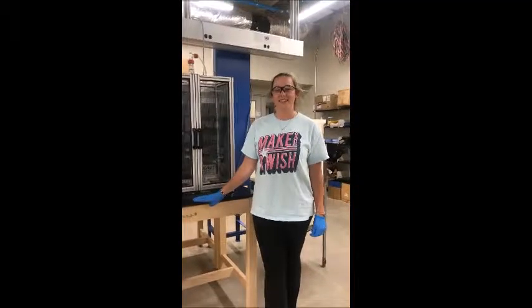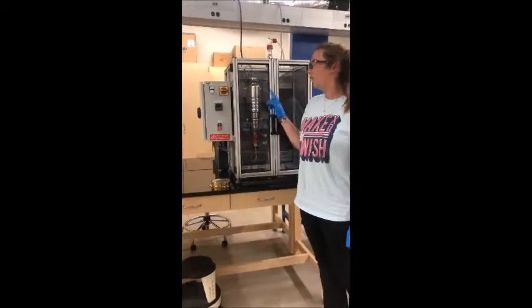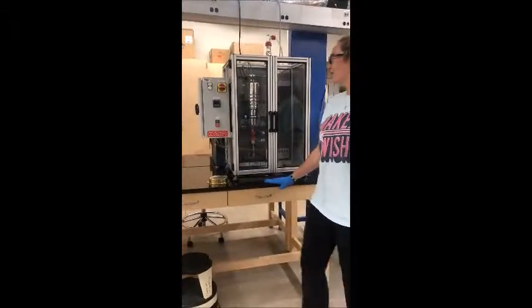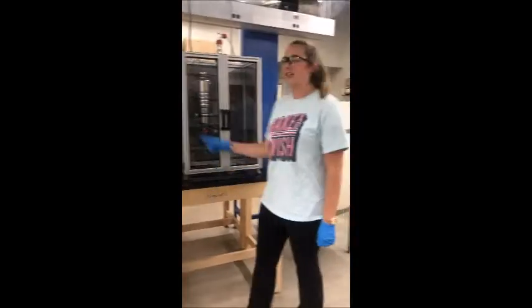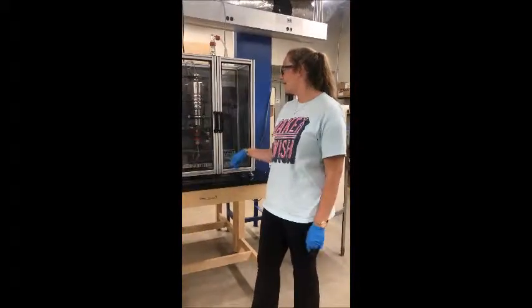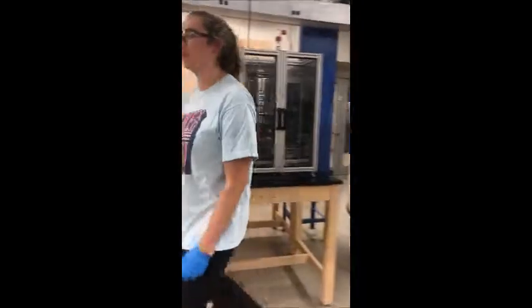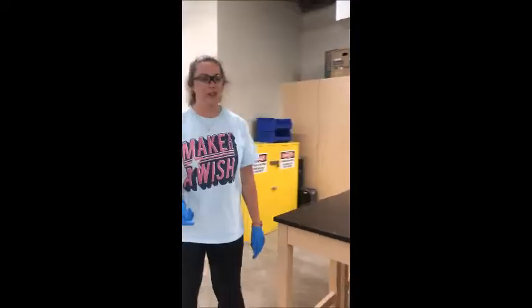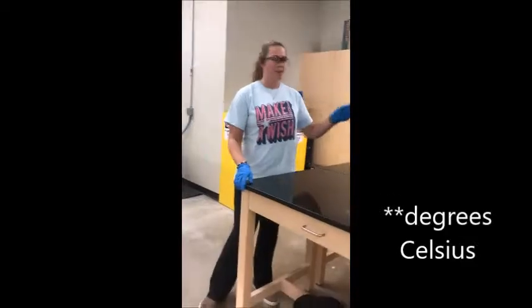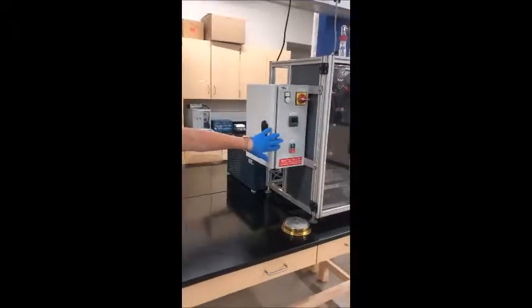To shut down this experiment, first you're going to remove the temperature probe, or the thermocouple, and fill the equilibrium still with 300 milliliters of heated water and turn on the heating source. Then you wait 15 minutes for the water to circulate and clean the inside of the apparatus, and then empty out the water, put it in a beaker, and flush it down the sink. Afterwards, once the water bath has cooled down to less than 30 degrees, you'll turn off the water bath and turn off the power source, and you're done.